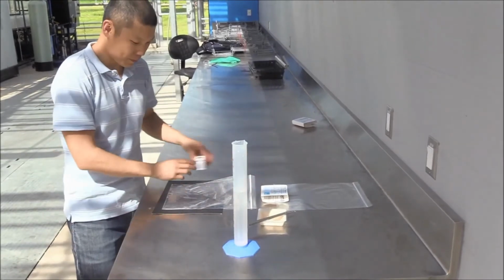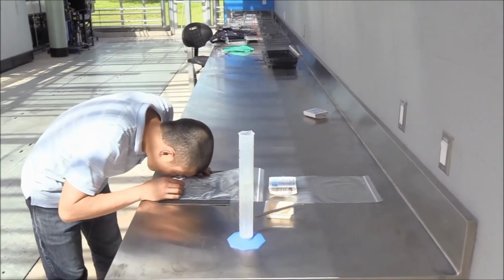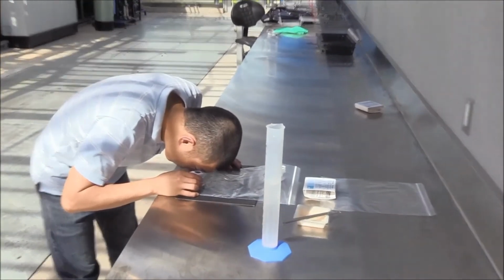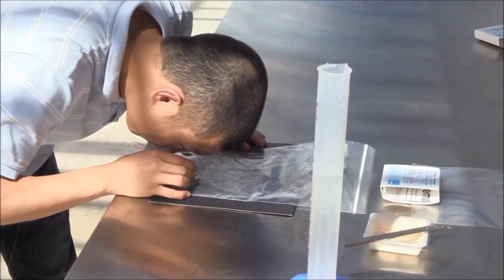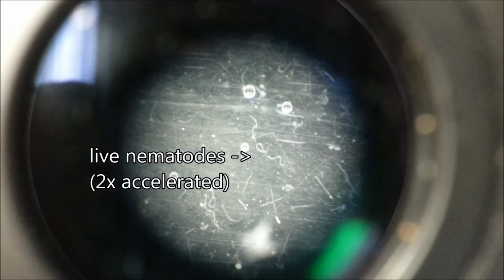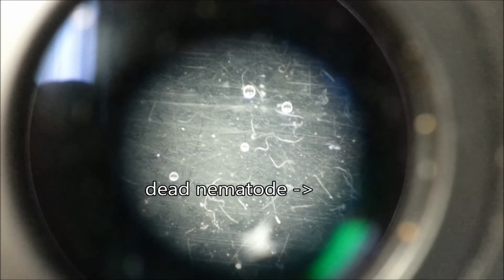To do this, you'll need something to create a dark background, and a hand lens or microscope to see them, as nematodes are less than 0.6 millimeters long. Live nematodes hold their body in an S shape, or have a slight J curvature at the end of their bodies. Most will move slowly. Dead nematodes will be straight and still.